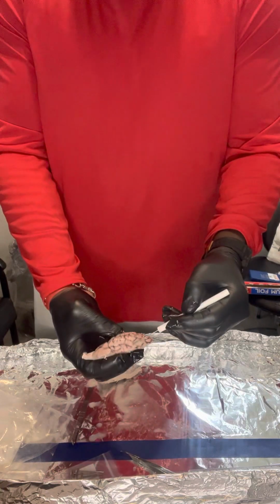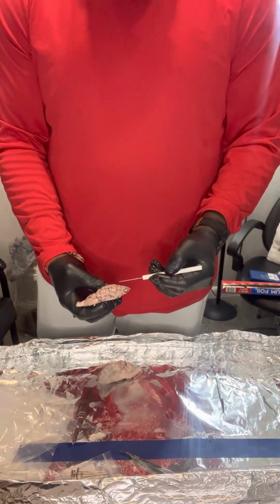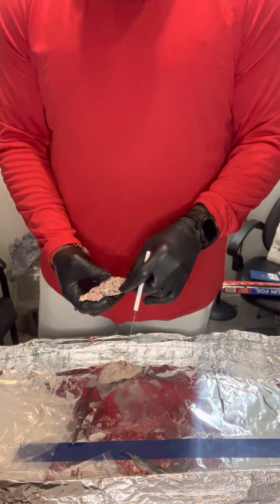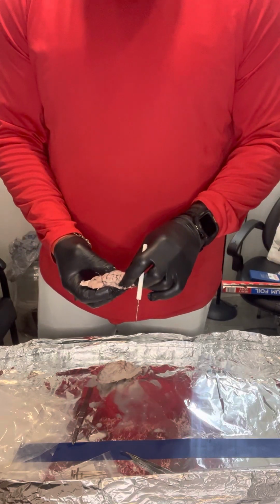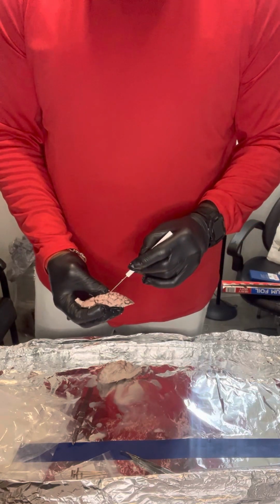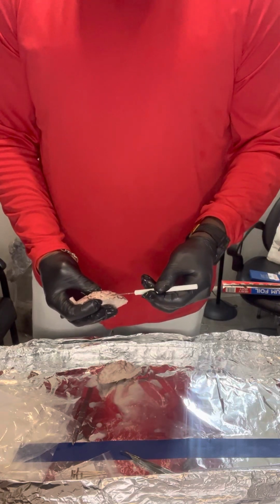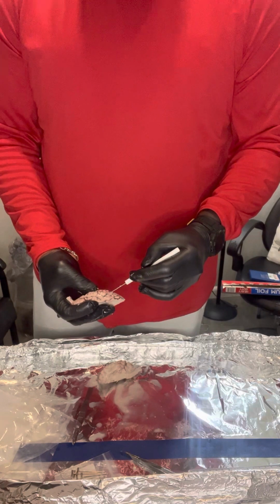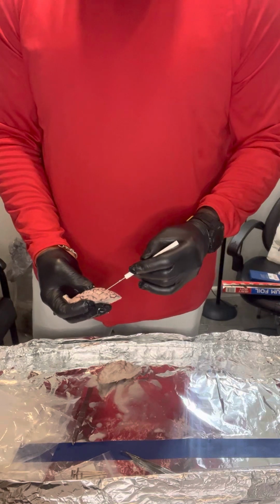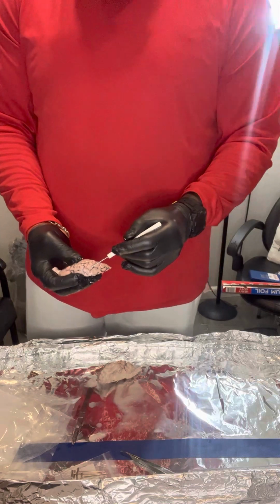I pray again that this is visible and can be seen by this camera. It segregates brain areas and enhances the surface area and cognitive ability of the brain, so brain capacity. These are the lines and the cross section. So the gyrus here is the outermost layer, and the sulcus here is the segregated brain areas, the sectionings of the brain areas.